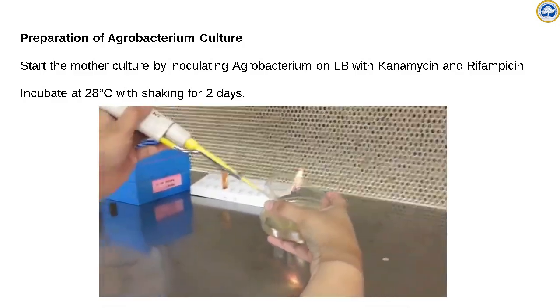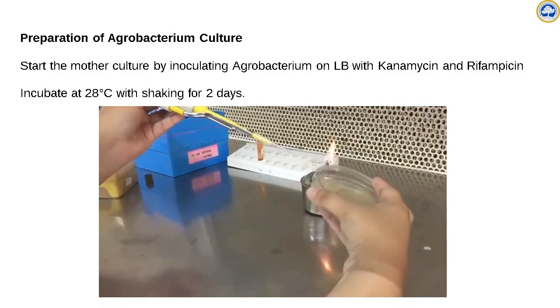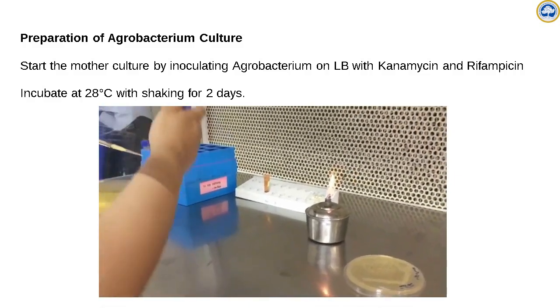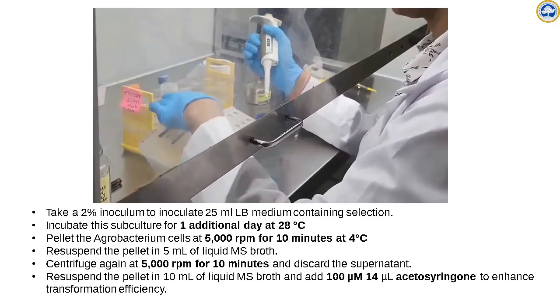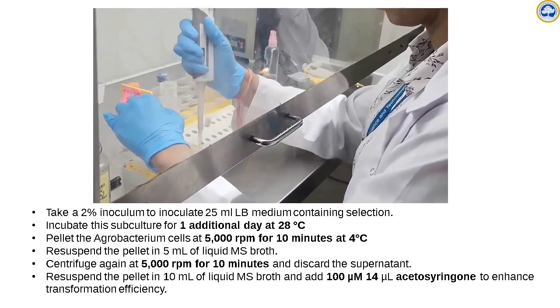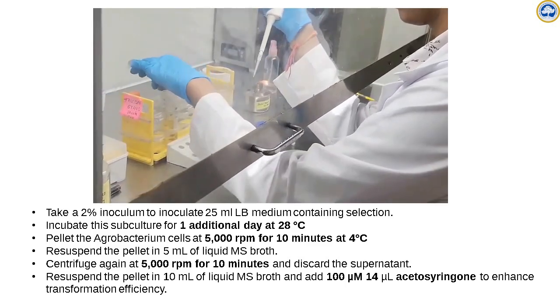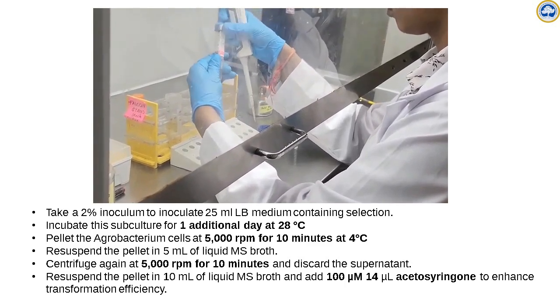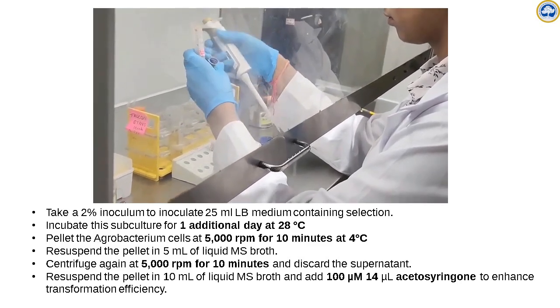Accordingly, rifampicin and kanamycin were added, and a single colony from the agrobacterium plate is inoculated into the 5 ml broth. This is cultured at 28 degrees Celsius, shaking, for 2 days. Once the mother culture is ready, we prepare the working culture by inoculating 1% or 2% of the inoculum into LB broth. The volume can be 25 or 50 ml as required for your experiment.